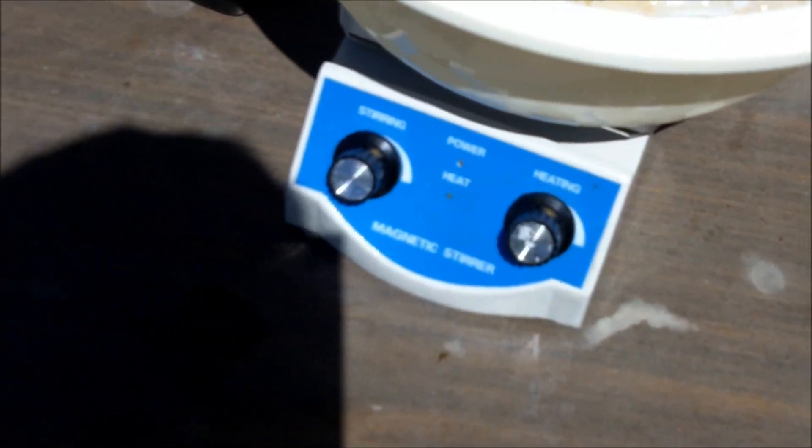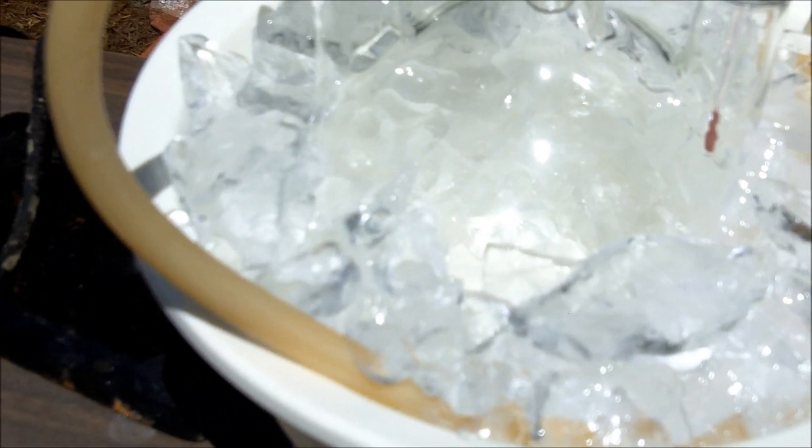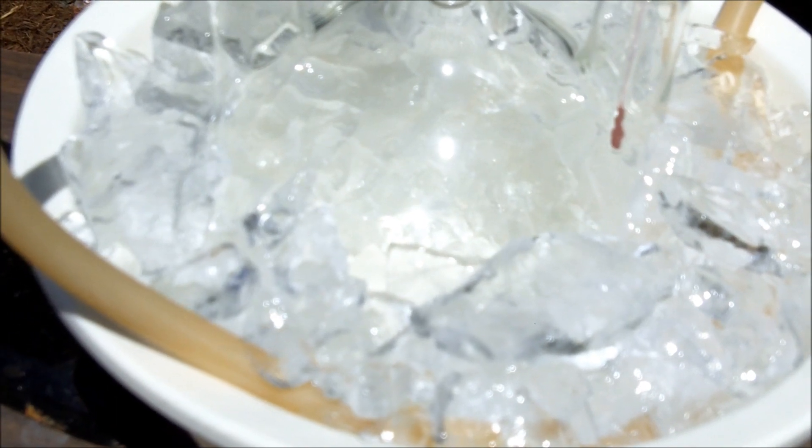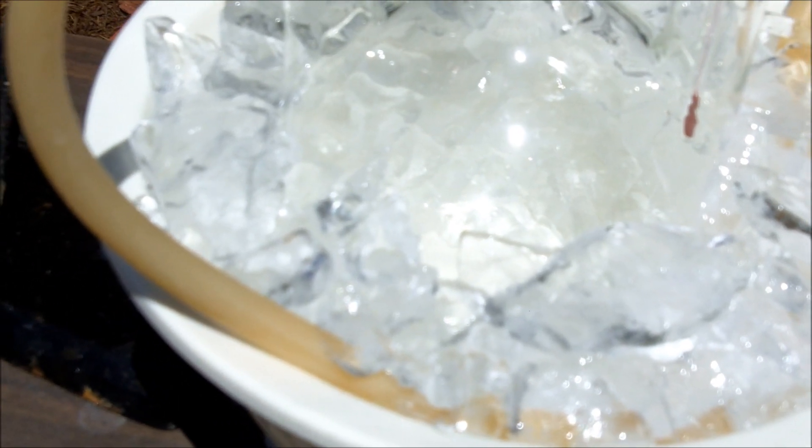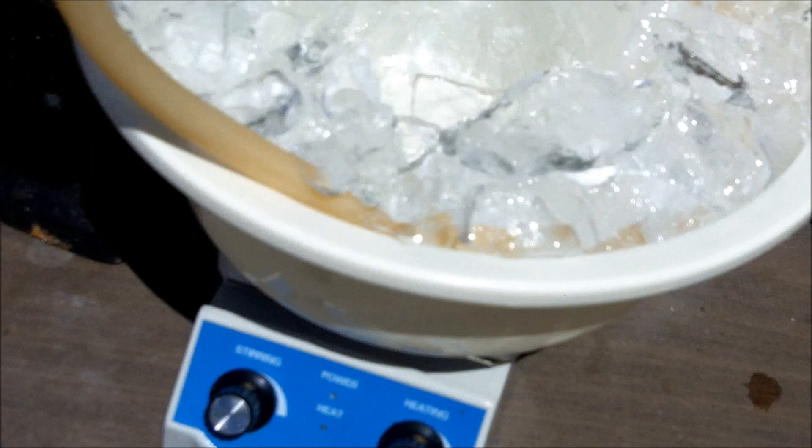Underneath it I have my hot plate. The reason that's there is for stirring. If I had an overhead stirrer I could use that instead, but I don't, so I'm gonna hope that my hot plate stirrer is powerful enough to stir through all that.